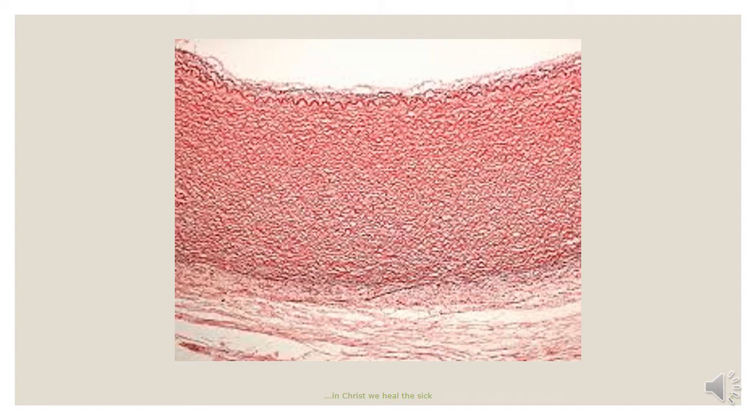This shows the slide of the elastic artery. There are two main types of arteries: the elastic artery and the muscular artery. The elastic arteries are large arterial vessels. They are large in such a way that a slide showing this vessel only takes a portion of the wall of the vessel. You can see just a little part of the lumen and then a portion of the wall of the vessel.